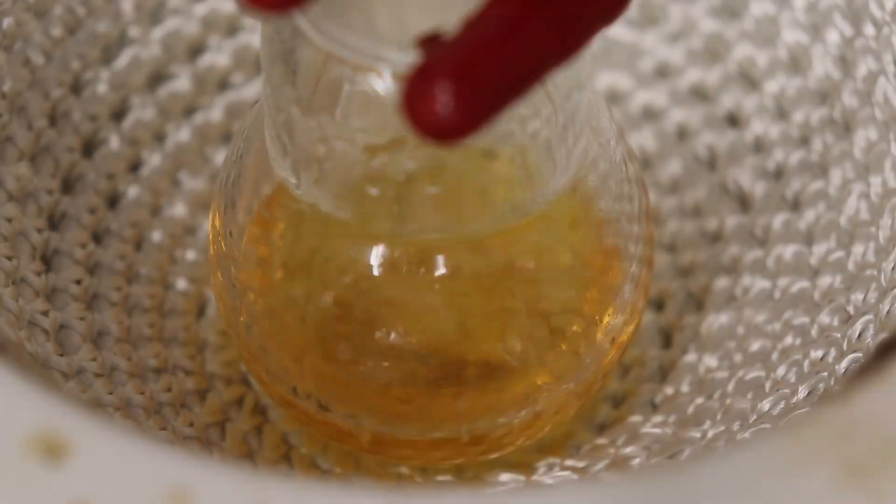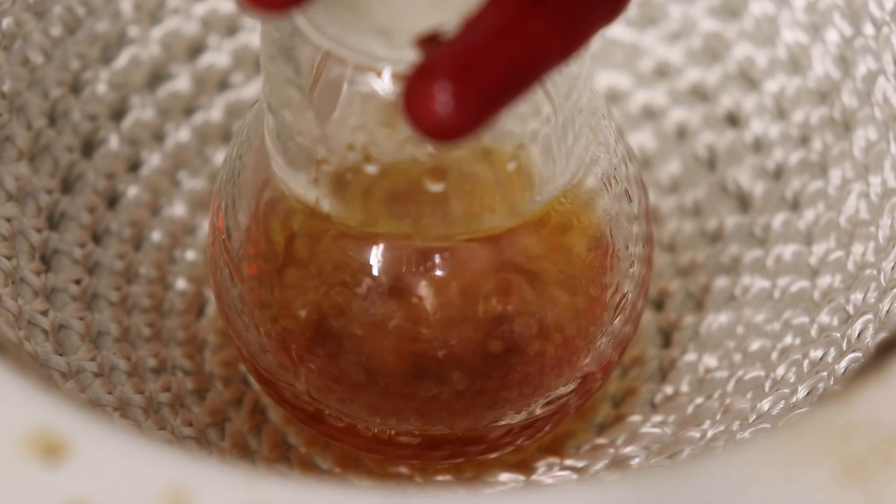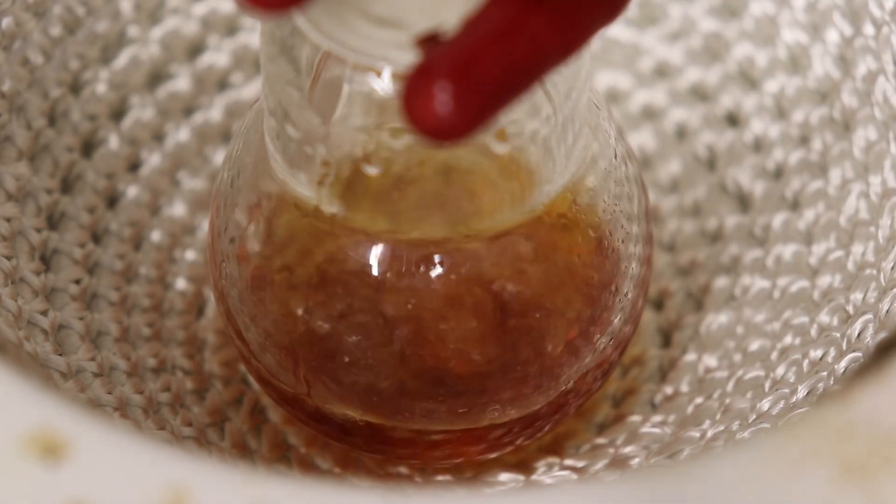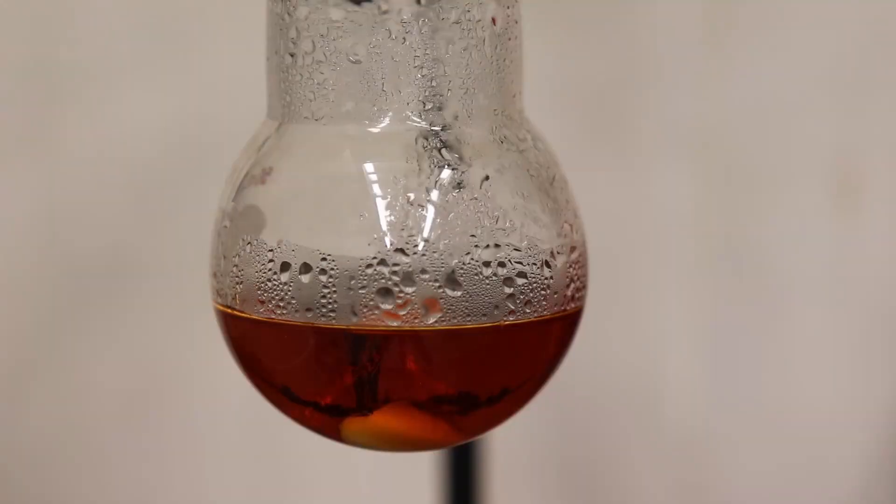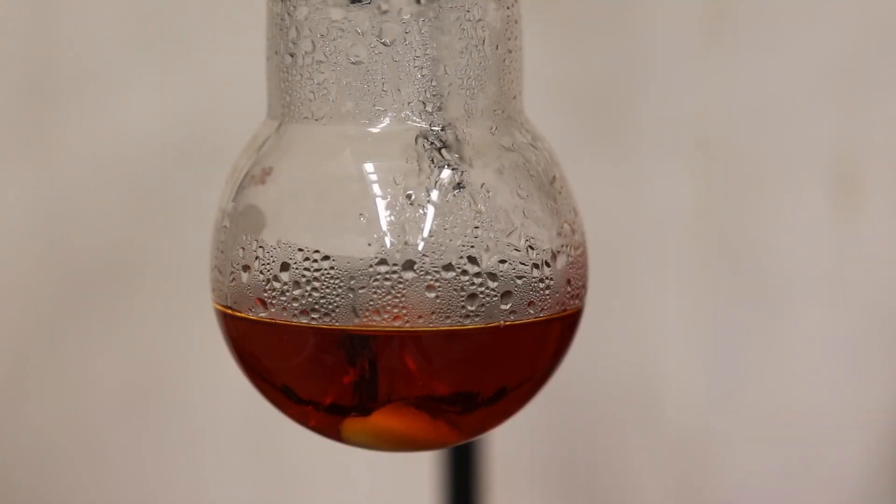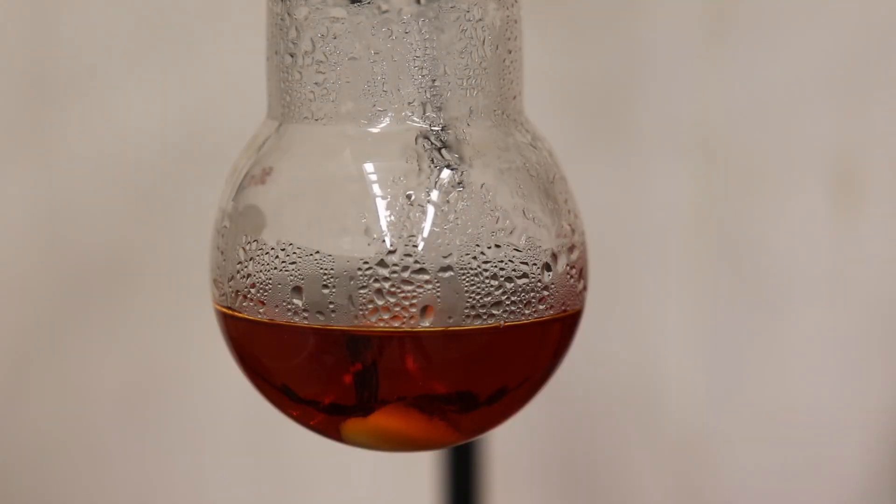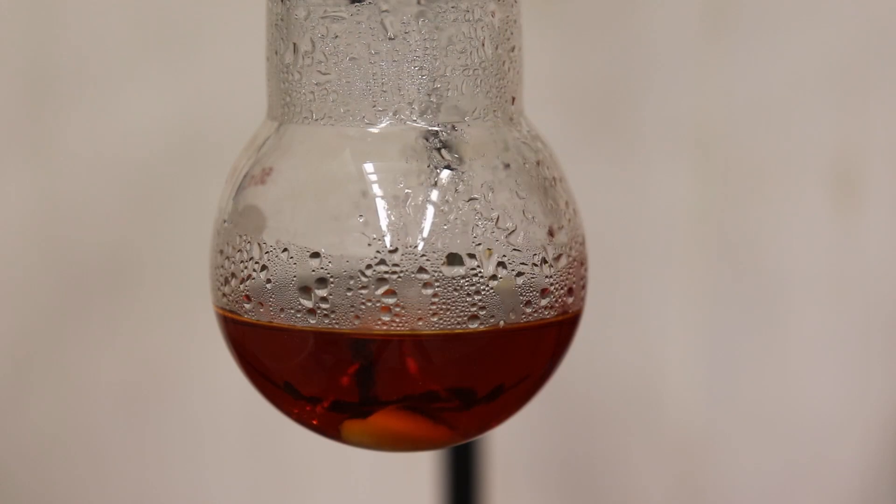Over the course of the reflux, the reaction mixture slowly developed a deep red coloration. After the hour-long reflux has elapsed, the mixture was taken off the heat and allowed to slowly cool down to room temperature, and while cooling, it spontaneously crystallized quite nicely.